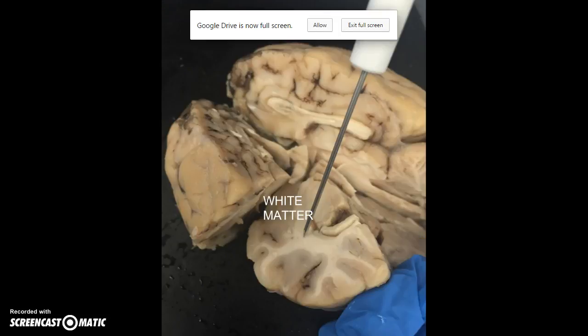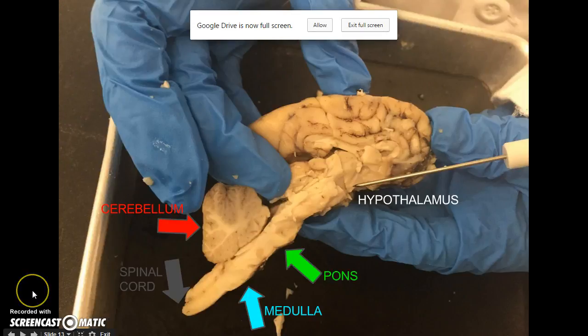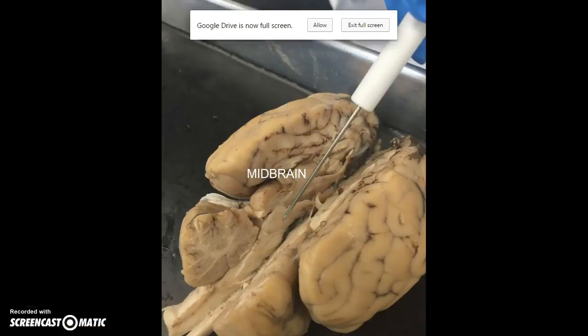There are two types of matter in the brain, white matter and gray matter. Here we point out the white matter, which is below and surrounded by the gray matter. And here we point out the gray matter, which makes up the cortex of the brain. This is another view of the midbrain, other than the ventral view.